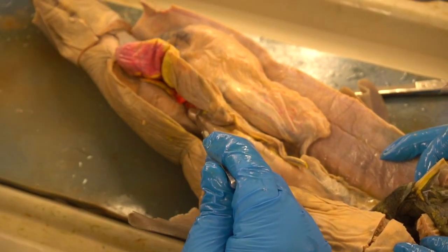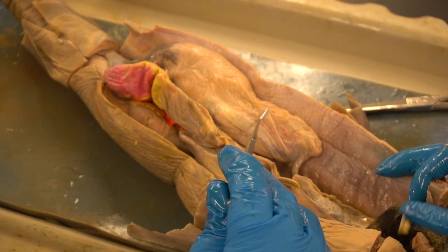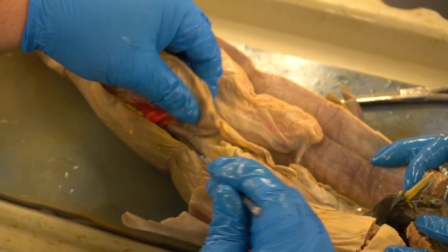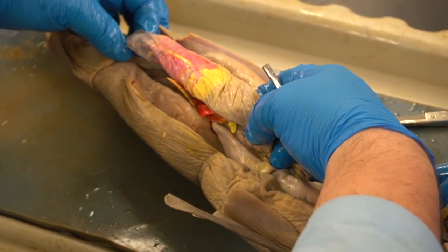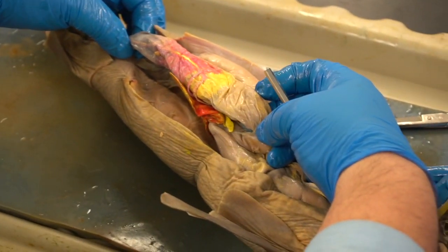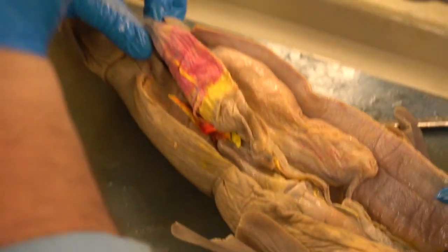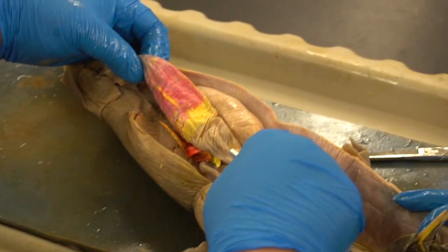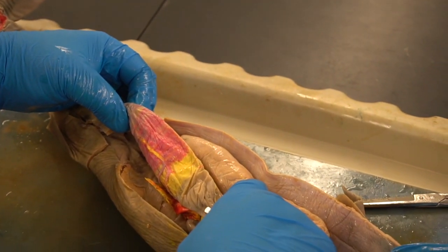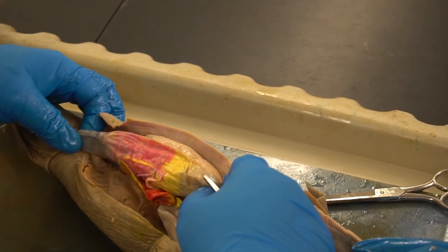As it gets all squished together, think of it like you're going through a car wash. Okay, you go through and your car is getting hit by all the fluids. That's what's happening here. As it travels through that, it gets squeezed down into this organ, which is called the spiral intestine. It's one long tube-like structure, and as you can see, it has a spiral interior. You can see by the evidence of the blood vessels around the outside. This is like a giant corkscrew of an intestine that goes down from top to bottom, and as food goes through here, the absorption of nutrients is going to take place, and the compaction of the solid waste, whatever is a waste product, that would be compacted towards the end.